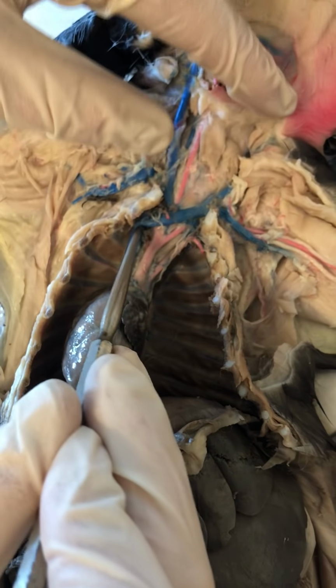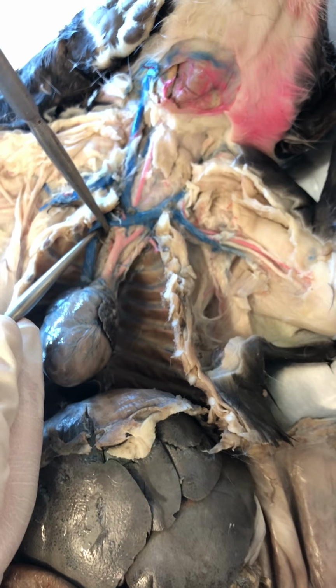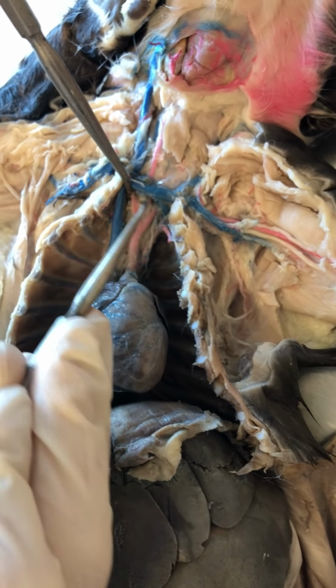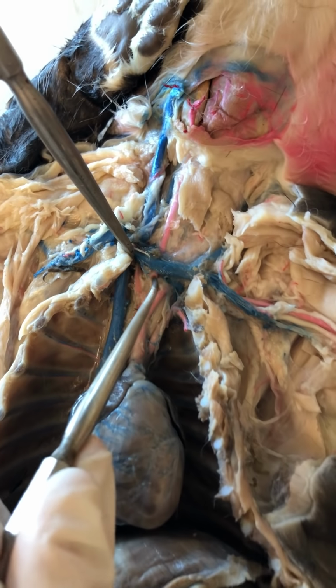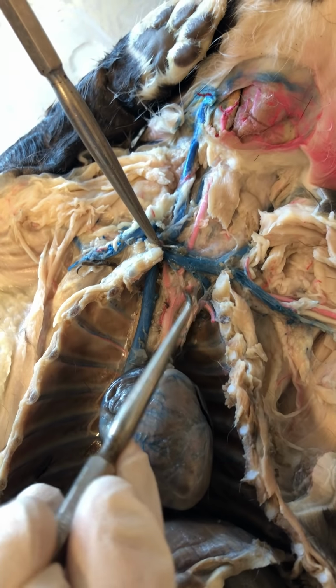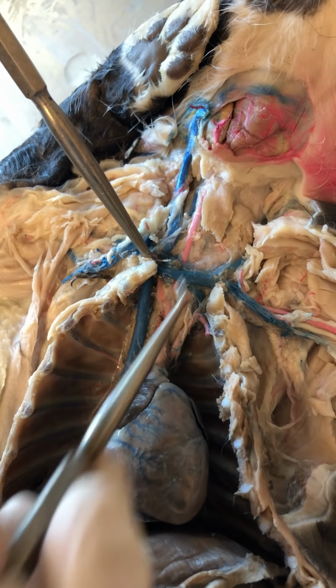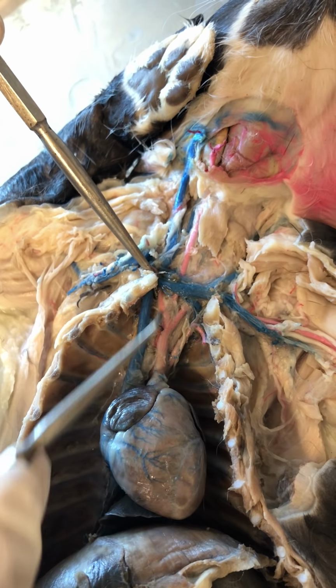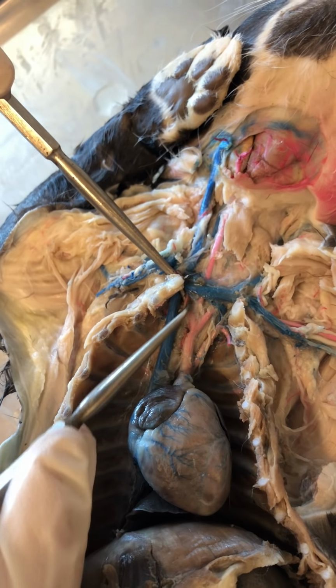Okay. So the brachiocephalic trunk for the artery also has 3 branches off of it. Okay, if I remove some of this tissue a little bit, you can see there's 1, there's 2 in the middle, and then there's the 3rd branch there. Okay. Nice. So these first 2 branches going up into the neck are going to be my carotid arteries. Okay. So then the 3rd branch going off into the arm is my right subclavian artery.